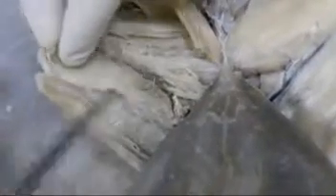and here we have the vastus medialis, the one that covers the muscles here, the vastus medialis, and inside we can find the rectus femoris and the sartorius muscle. It's here. This is the sartorius muscle.